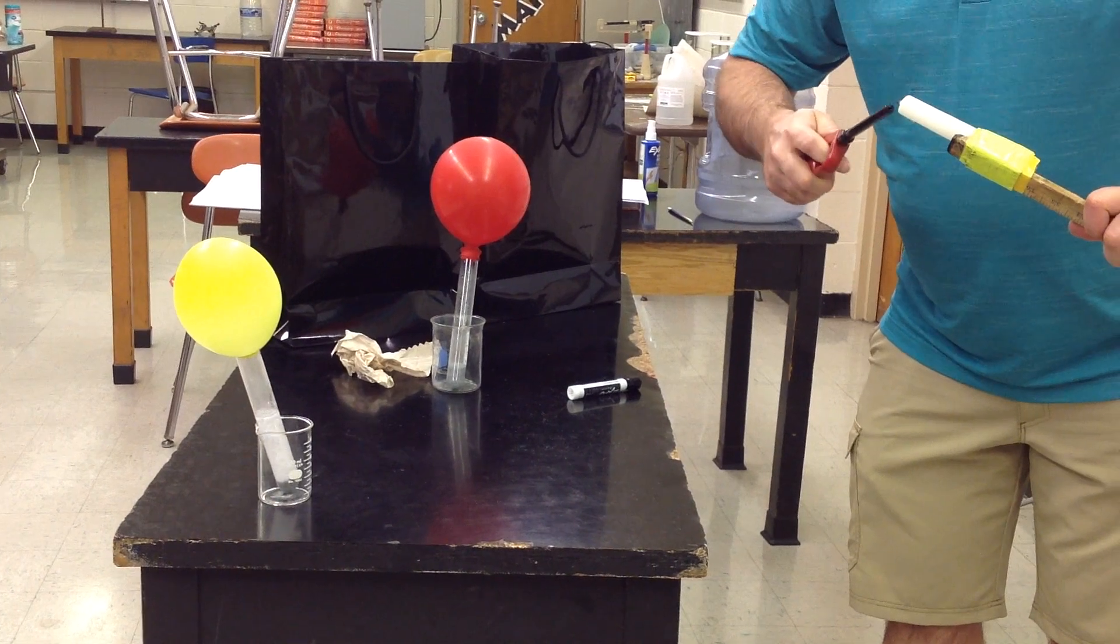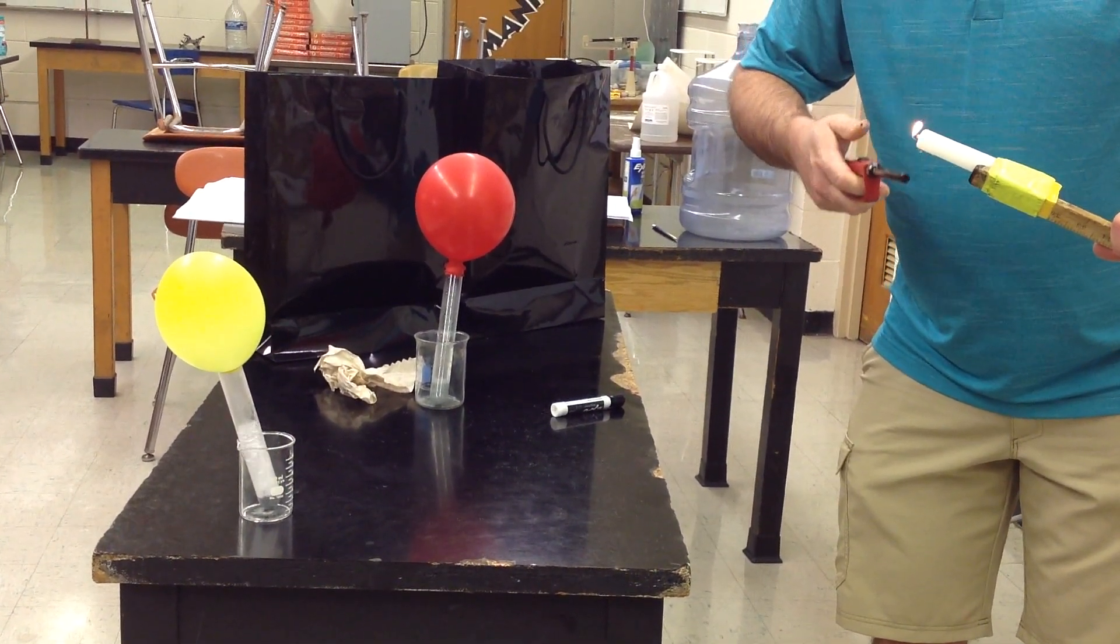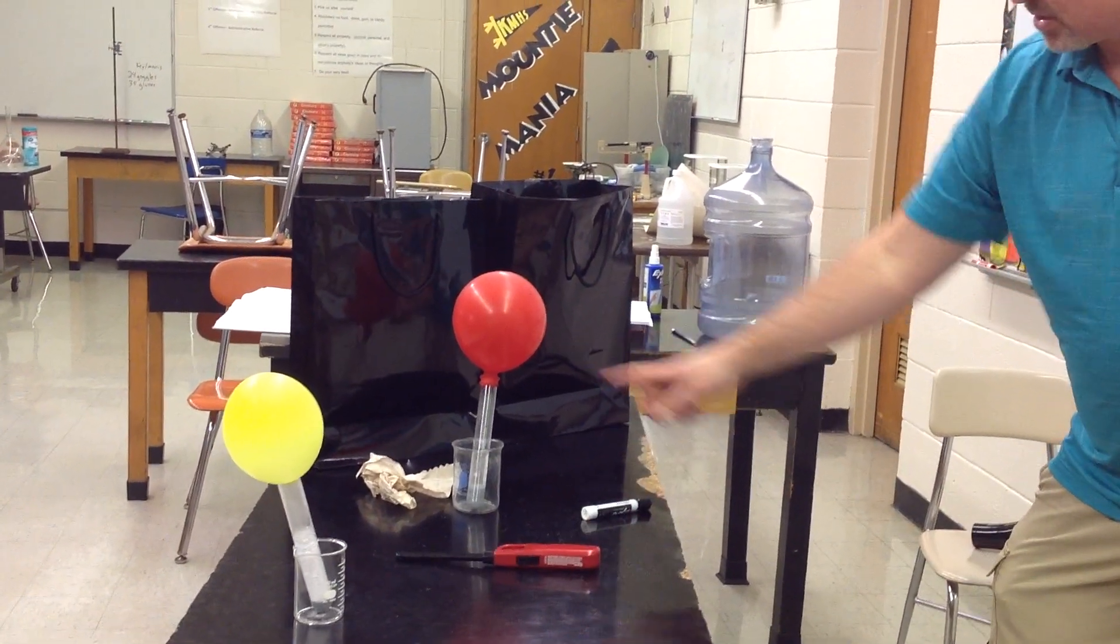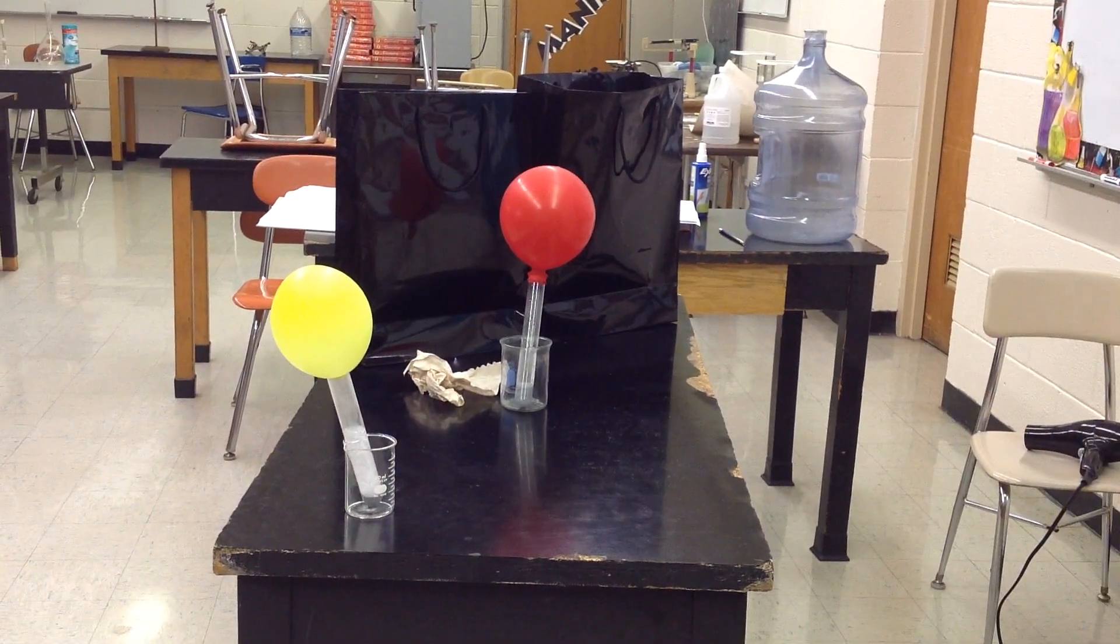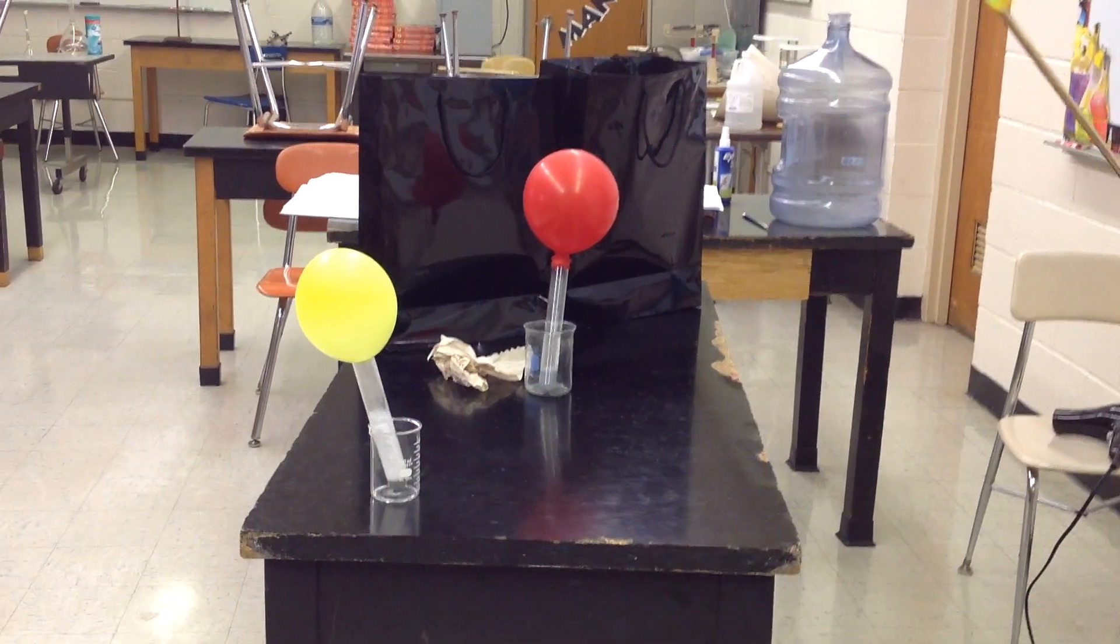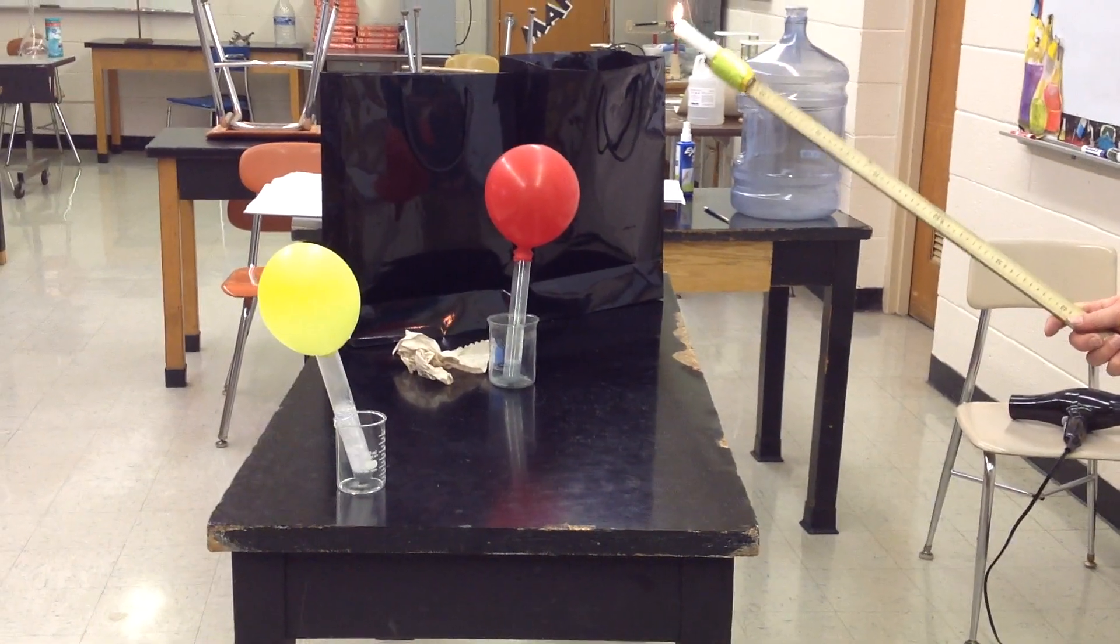Let's see, we get the wick out of the wax so we can actually get it lit. Yay, we got the candle lit! So now, whenever we place this underneath this balloon, what do you think will happen? Well, if it's an explosive gas, we'll know it real quick. Are you ready? Okay, here we go.